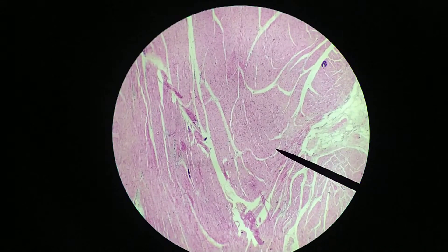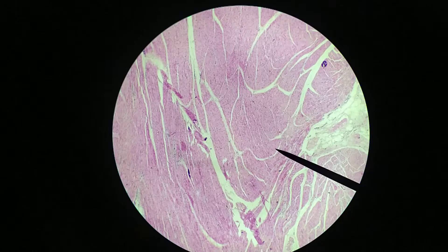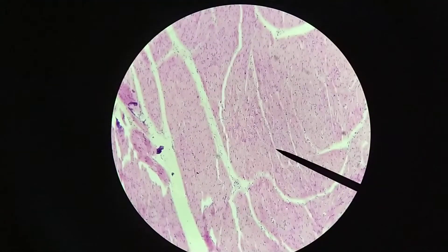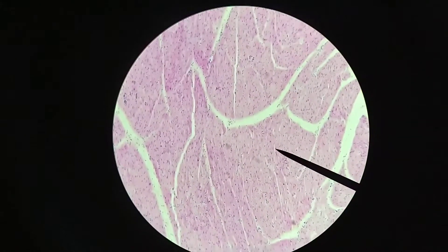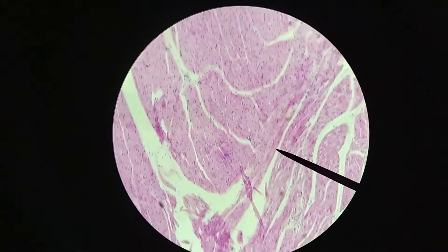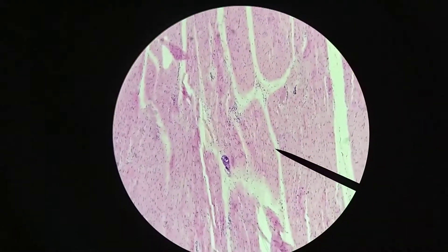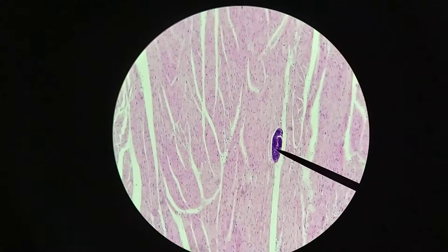Let's go to higher magnification — this is 40x, let's move on to 100x and get a bit more detail. Here we've got some cardiac muscle, probably mostly longitudinal section here. We'll zoom in on that in a minute, but I'd like to explain something before we go on. You may have noticed some of these basophilic spots in a few places on this slide.